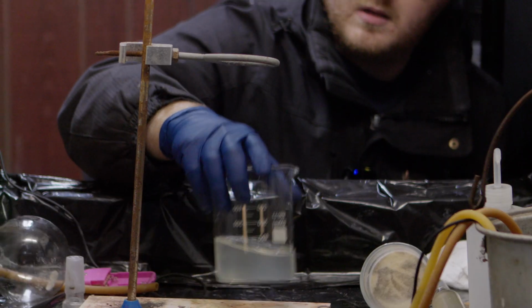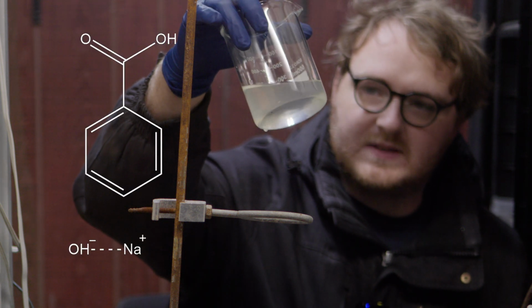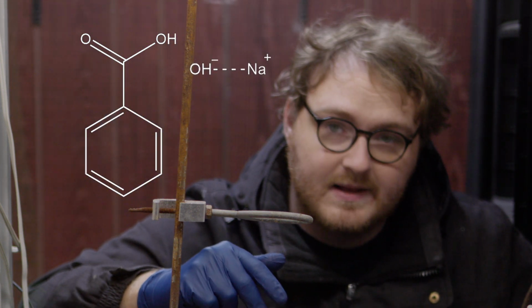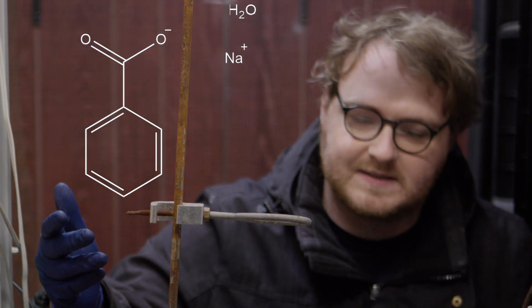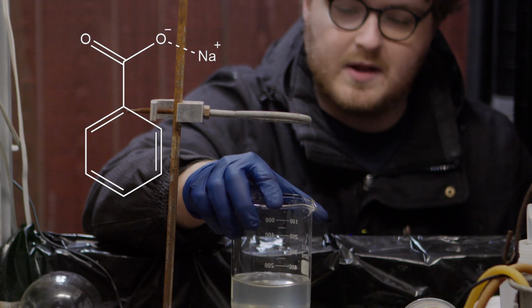Okay, now that we have the toluene gone, it's mostly just benzoic acid and water. There's also sodium hydroxide, which makes the whole thing basic, and that's actually an important detail. Because the sodium hydroxide is basic, we can think of the hydrogen on the benzoic acid as gone. It's already been taken off by the sodium hydroxide, and we have a salt. And salts are very soluble in water, that's why it's dissolved in the water.